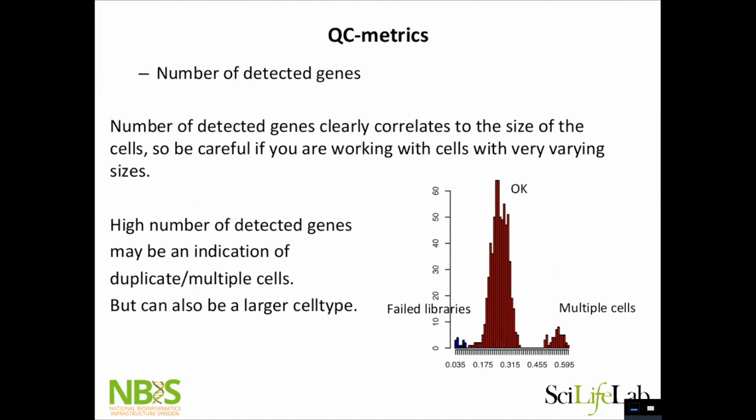Okay. One thing to look at is the number of detected genes, as we already talked about a bit when it comes to doublets. It will give you an indication of whether it's a single cell. In this very example, they did some samples with 100 cells, and some with single cells. And then we clearly have some failed libraries out here. So when you have a really nice homogeneous population with the same cell type that should be the same size, then I'm fairly confident to just use the number of detected genes to filter out cells. But if I have mixed sizes of my cells, it's harder.